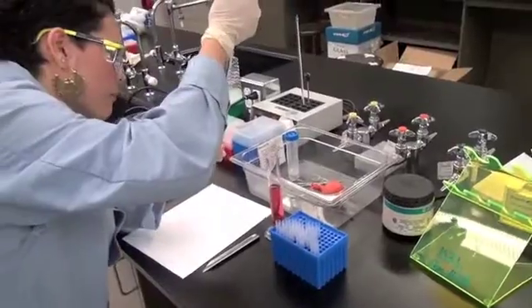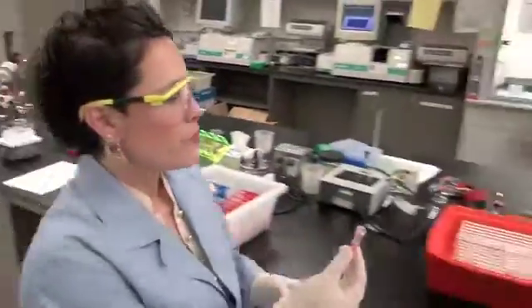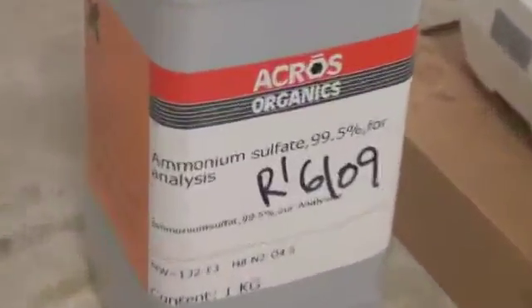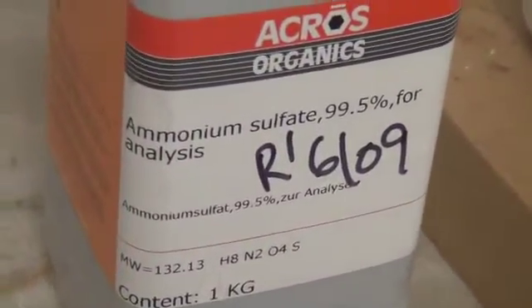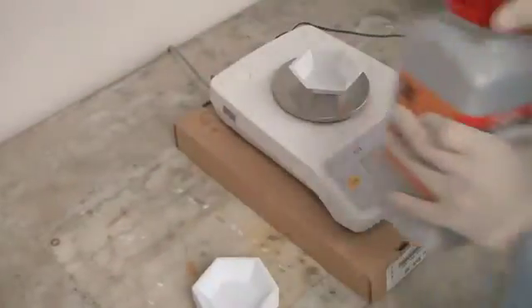Right you are, Dr. Beckman, and Biochemist Dicer is now about to hand over the test aliquot to the assay team. This is an exciting day, and the assay team is equally important to competitors, as they need to know whether their crude extract contains enzyme, which should be the first monitoring assay run during the lab. Protein assays will be run at the end of the lab when you have all your test aliquots.